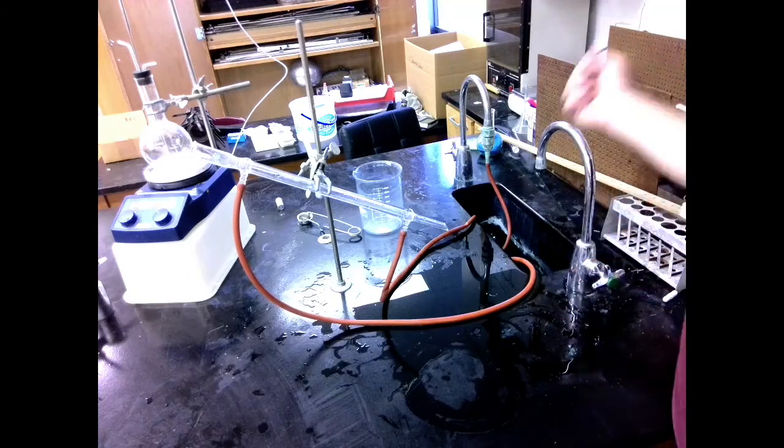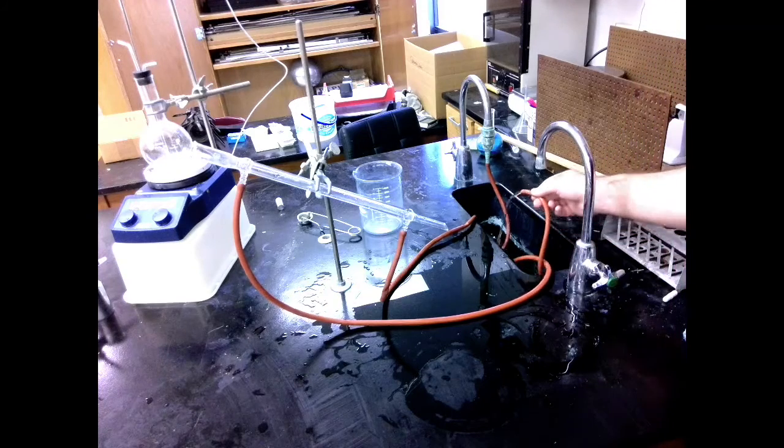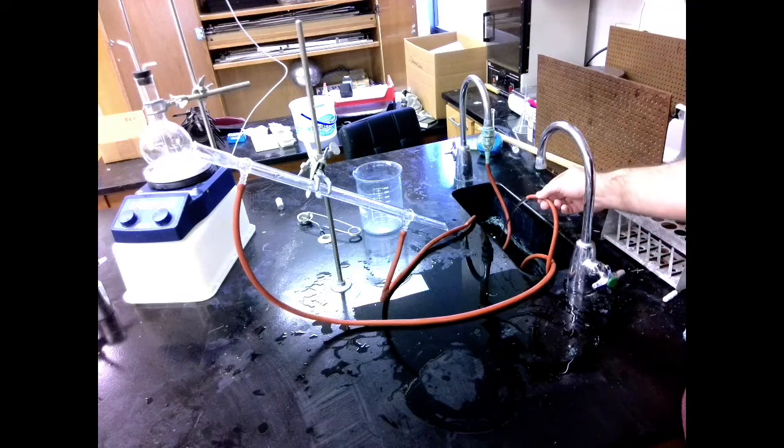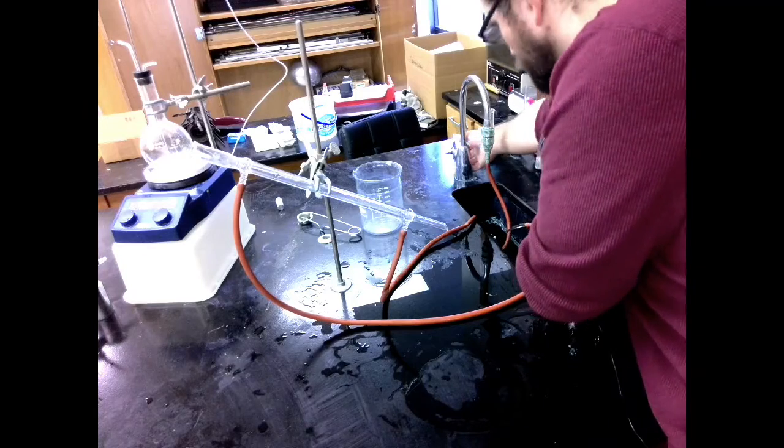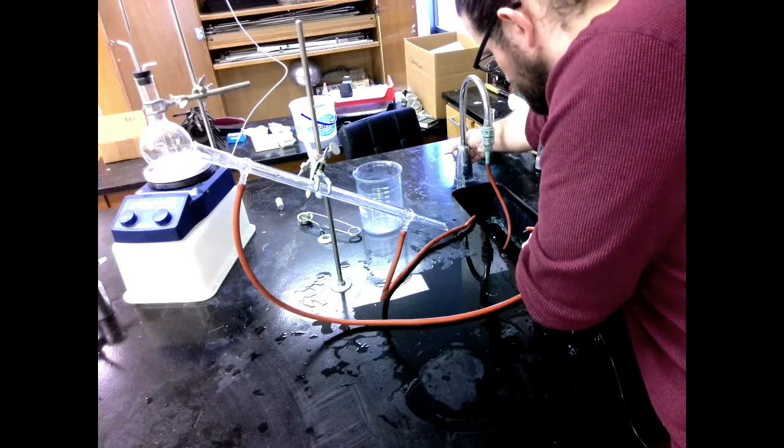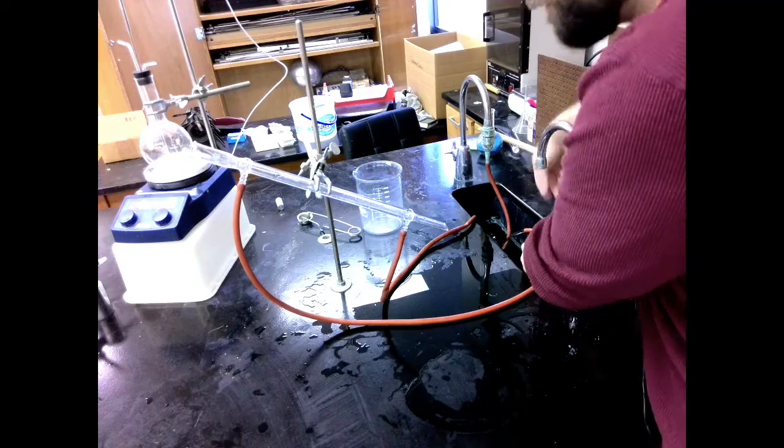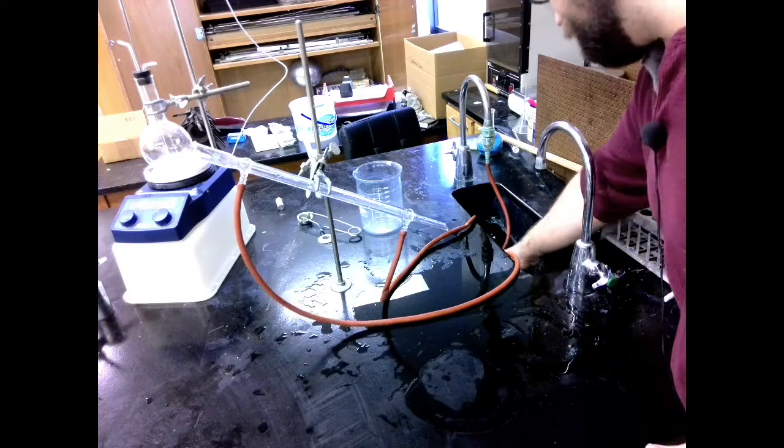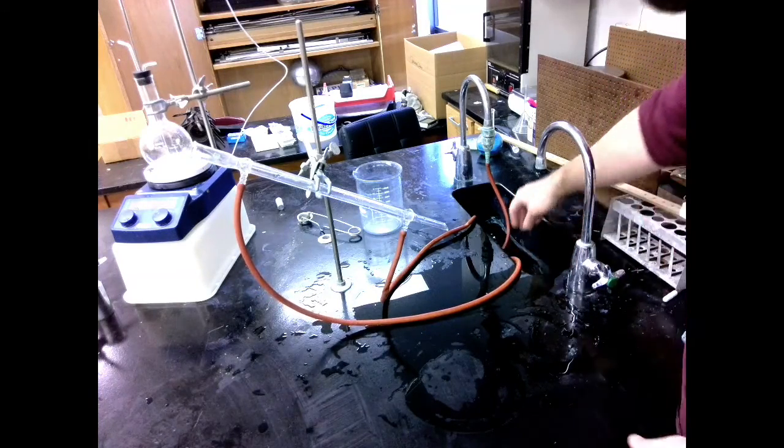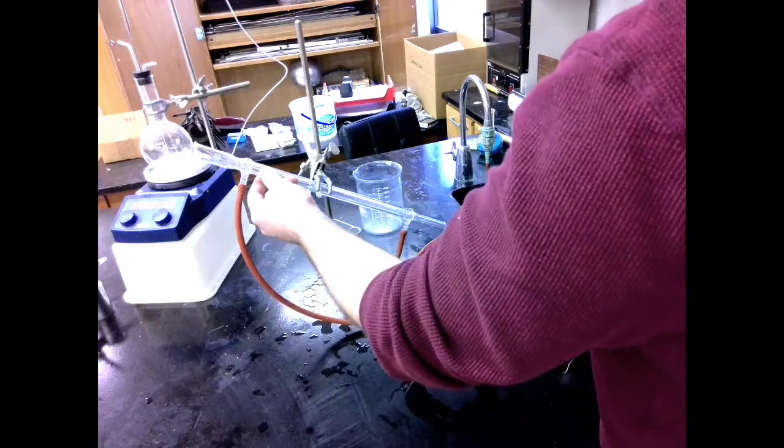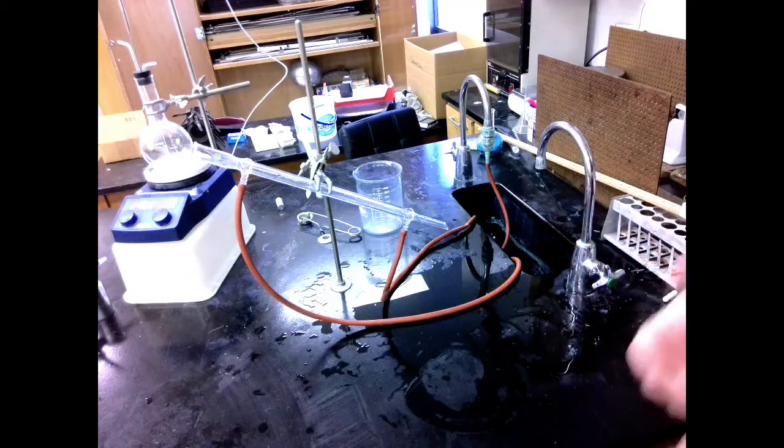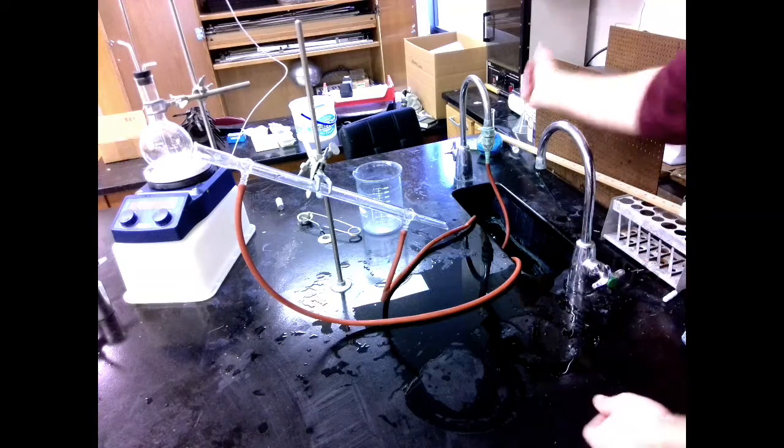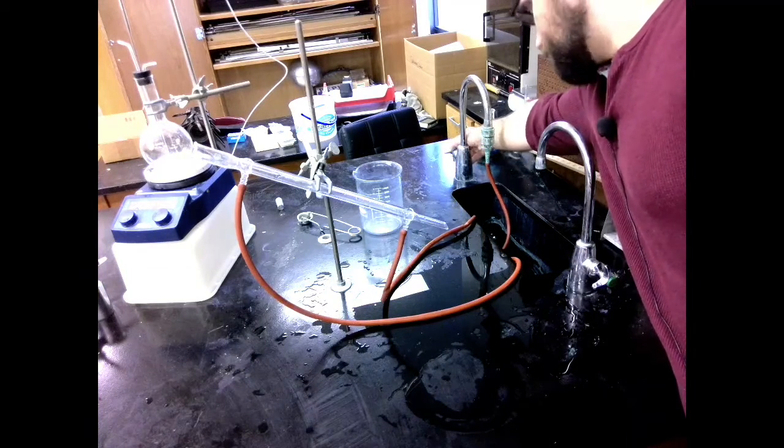I can see that I've got a decent amount of water coming out of here. It's not much, just barely a trickle. I might want a little bit more than that. There we go, that's a good amount. This should not be flying all over the place. I should not be getting water everywhere. Just enough that water is flowing through here. We aren't cooking at super high temperatures here.